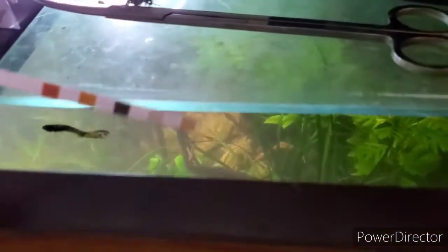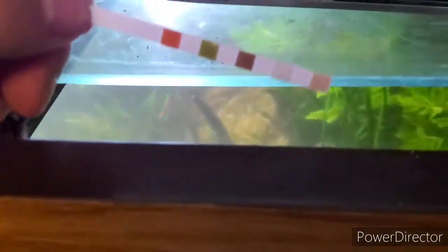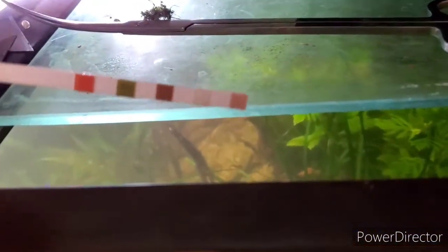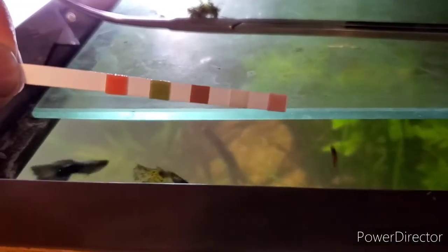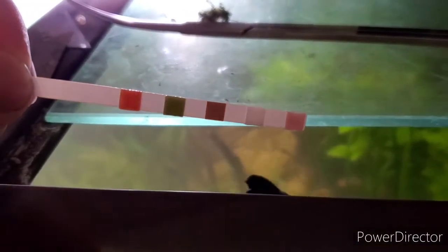Alright, so all you do is you take your test strip, dip it in the water, give it a quick shake, then you let it sit, and it will start to change.